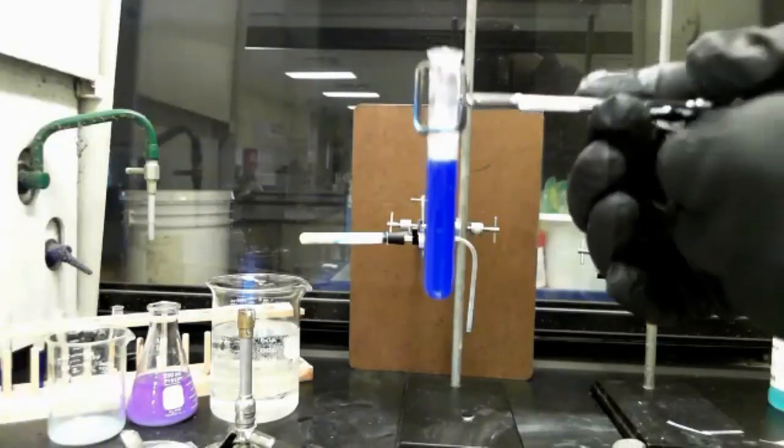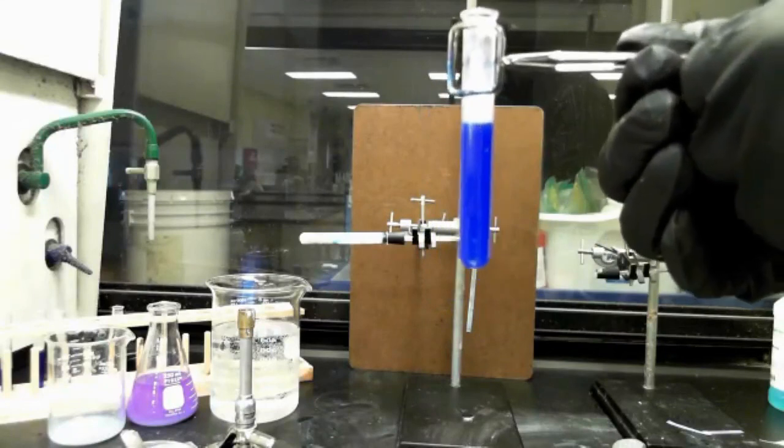And I'll set this off to the side and we've got our nice blue solution there. So that's the blue solution that your instructions will tell you about. Okay. Oh, there you go. Yeah. All right.